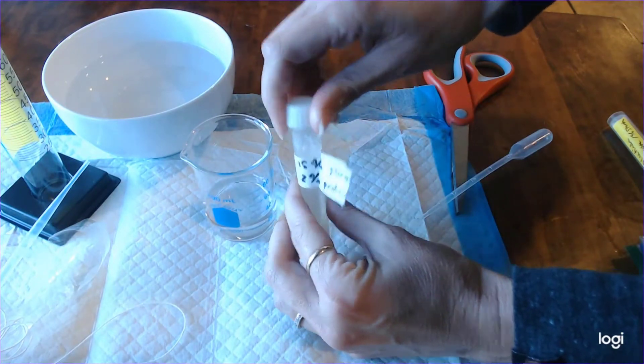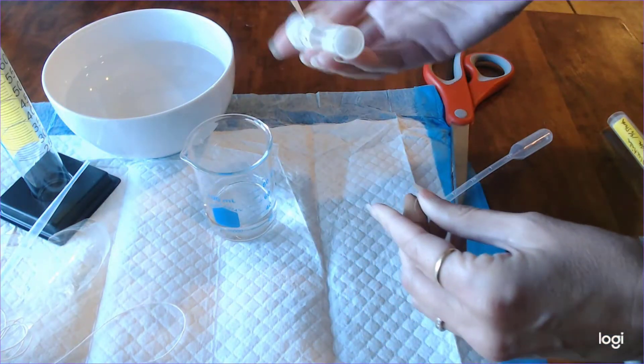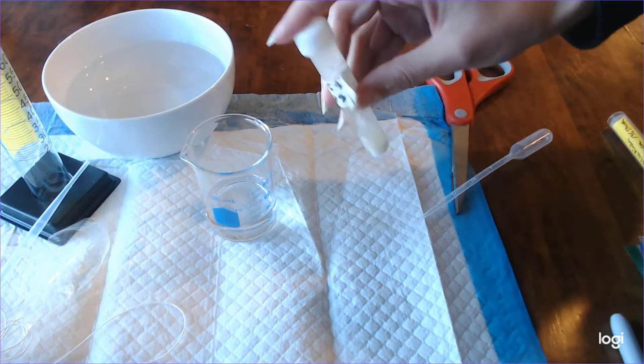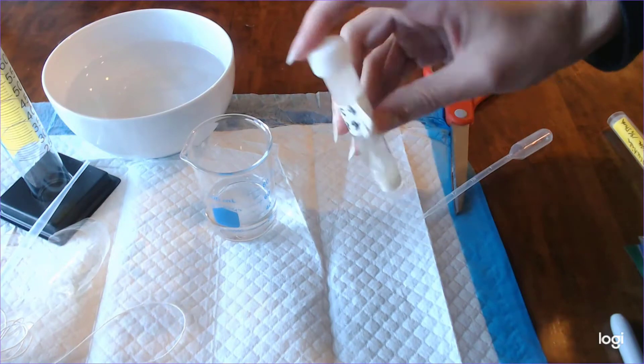Once I do that I'm going to go ahead and cap it. Make sure you've got a good handle on it so you don't spill it. Cap it thoroughly and then I'm going to shake it up and what I found is that that actually doesn't do a very good job dissolving the powder.